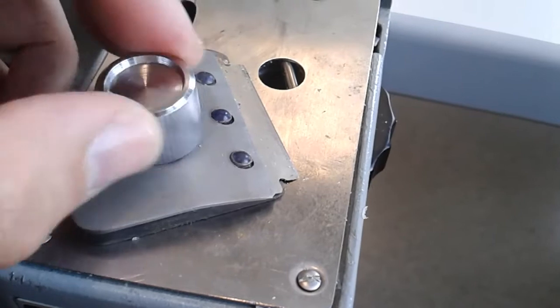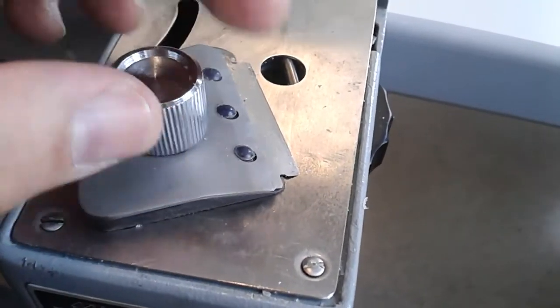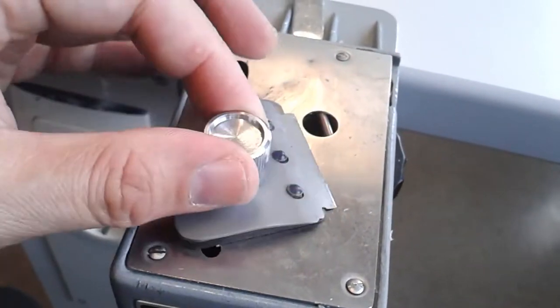The razor blade can be exchanged by unscrewing the top part over here. Then you can exchange it, but I think I am not going to do this right now. Simply by moving it across like this, you can make the different cuts.